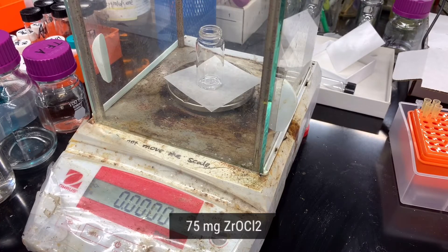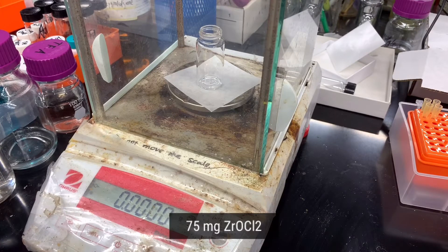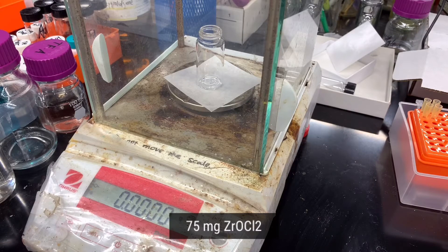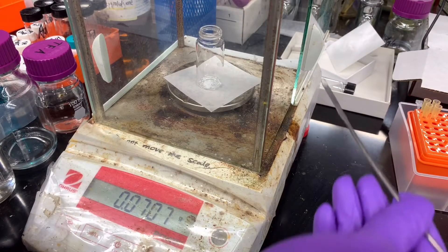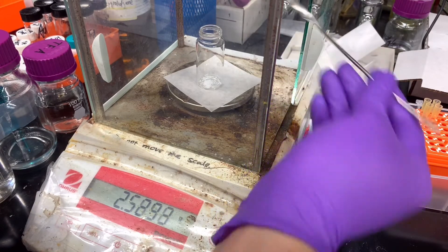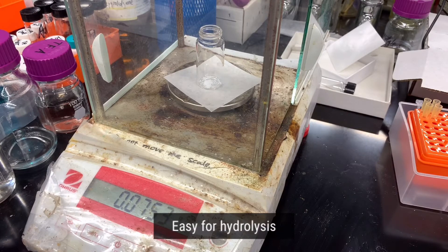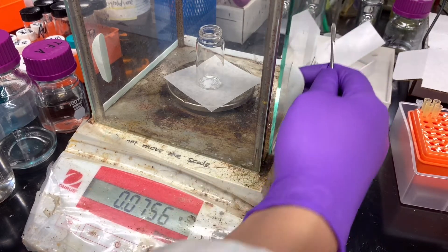First, we need to add 75 mg of zirconium dichloride oxide to the glass vial. This metal salt is very easy to absorb water vapor from the air, so it should be stored carefully.